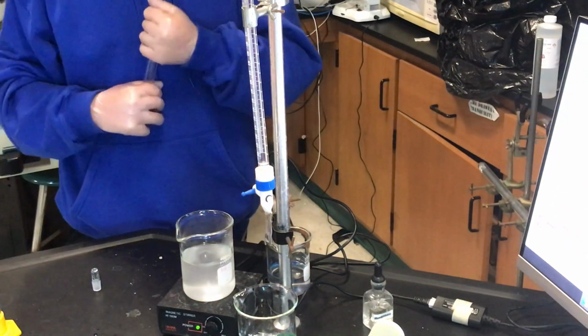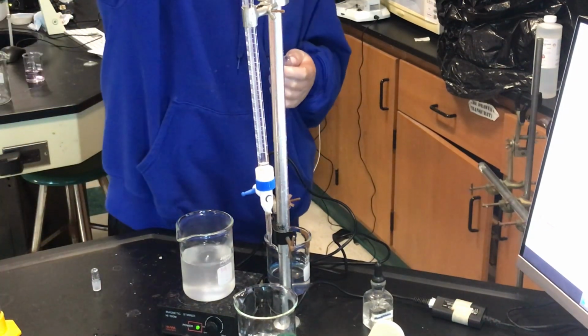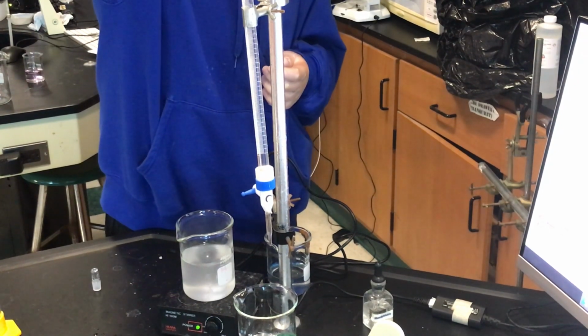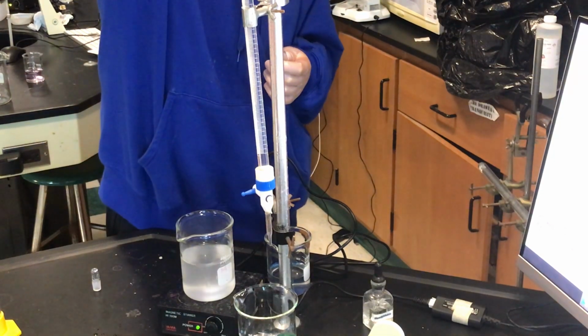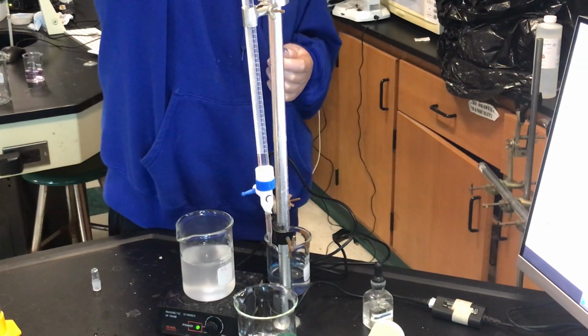We only need 25, so we should have more than enough. Okay, pour that in all the way to the top. Don't overfill it, let it go down, good. We get every little drop because we may need it. Good. Okay.